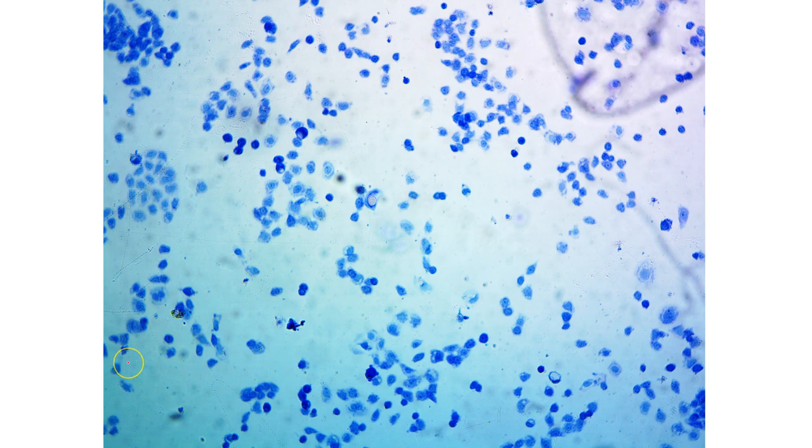These are the same cultures at 100x. This one is a different set of culture, obviously, because this is a lot lower confluence, and you can see the difference in cell number. Again, already you're looking at a smaller area. But looking at this one, you want to think about the general confluency of the culture. You're looking at overall cells in this area, and you're looking at what percentage of the surface area is covered with cells. And this one is obviously a lower confluency.